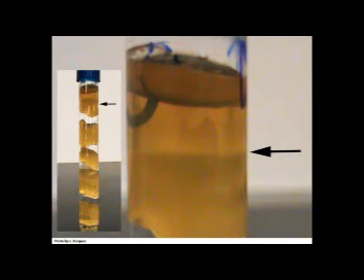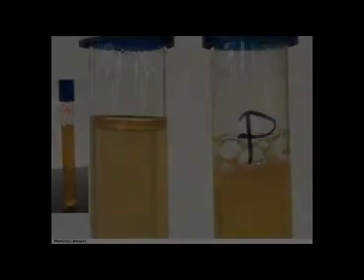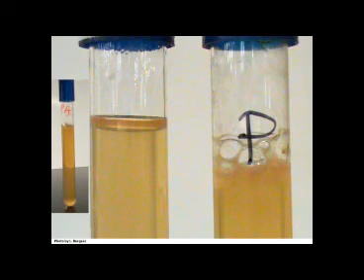Now shown is Clostridium. Clostridium is an aerotolerant organism. Aerotolerant organisms are only capable of anaerobic metabolism. However, they are capable of growing in the presence of oxygen. They simply do not use it in their metabolic processes. The arrow is pointing to the end of the line of growth towards the top of the tube in Clostridium. Clostridium will grow in the bottom 3/4 of the tube, but will not grow near the surface. This is because although aerotolerant organisms do not use oxygen in metabolism, high concentrations of it can be toxic to the organism.